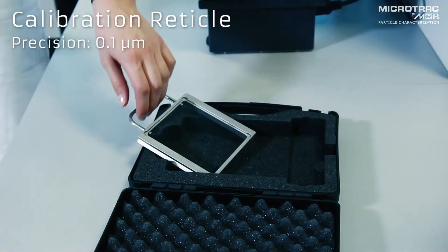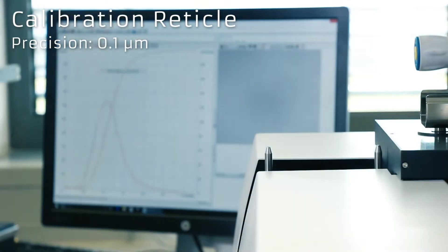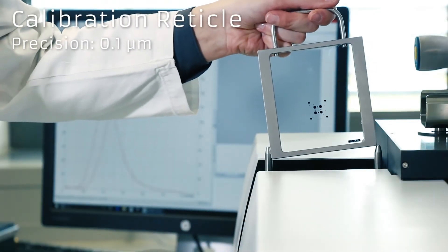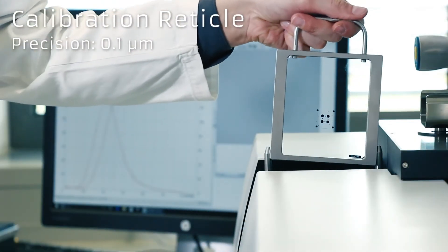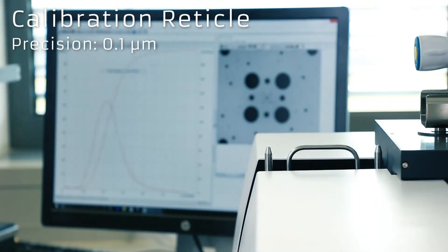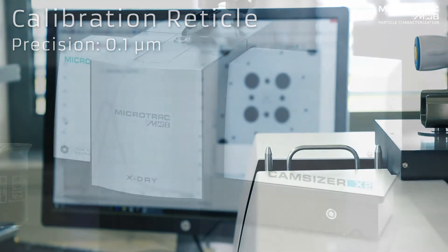The magnification of the cameras is determined using a calibration reticle with a precision of 0.1 micrometers. Recalibration of the instrument can be done anytime within a few seconds.